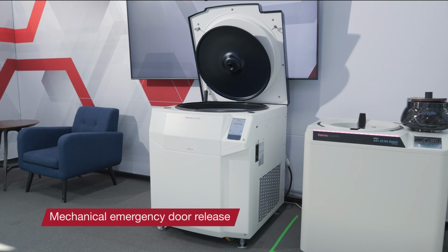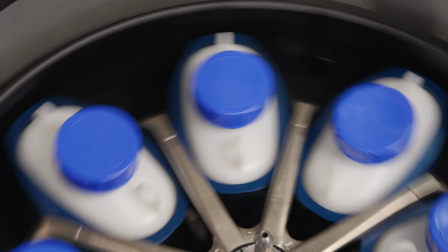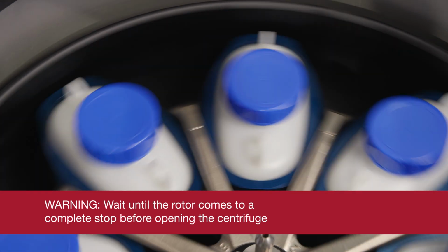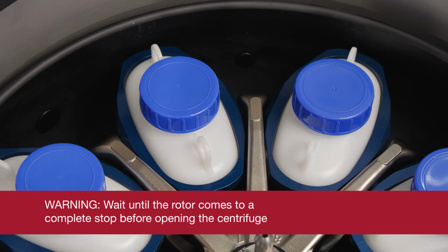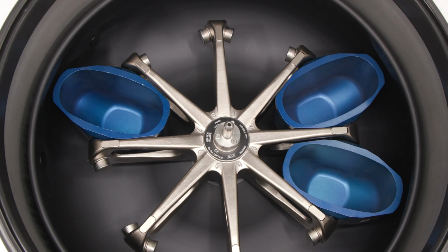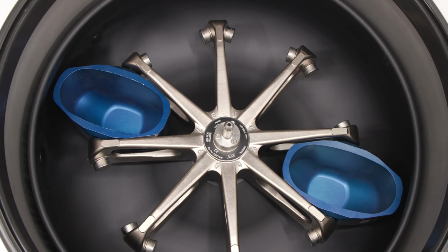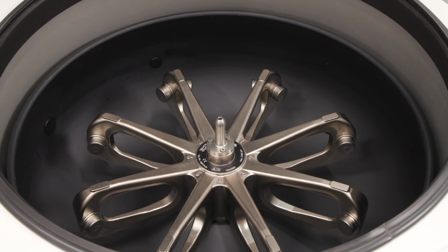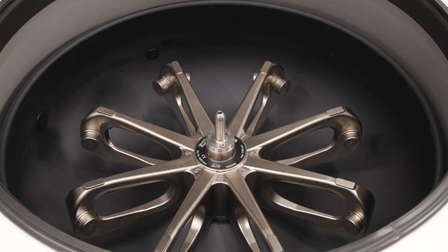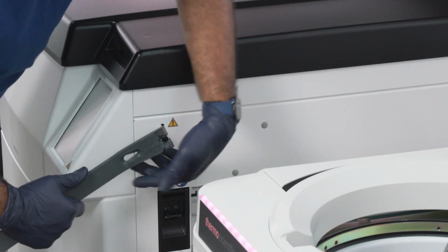Should a power failure occur, you'll need to use your centrifuge's mechanical emergency door release. A few words of warning: do not open the centrifuge before the rotor has stopped spinning, and never touch a spinning rotor. Also, never use your hands or tools to stop a spinning rotor. A rotor can still be spinning after a power failure occurs. Always wait until the rotor comes to a complete stop before operating the mechanical emergency door release to open the centrifuge. Once the rotor has stopped, unplug the power supply.